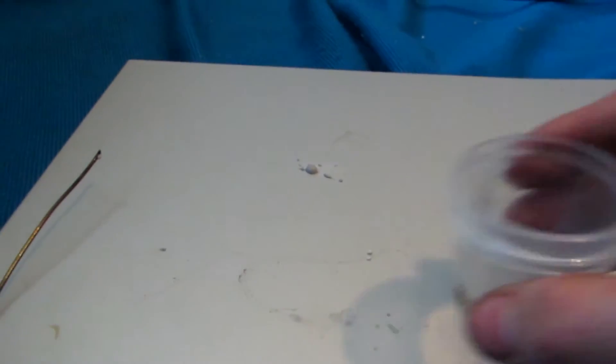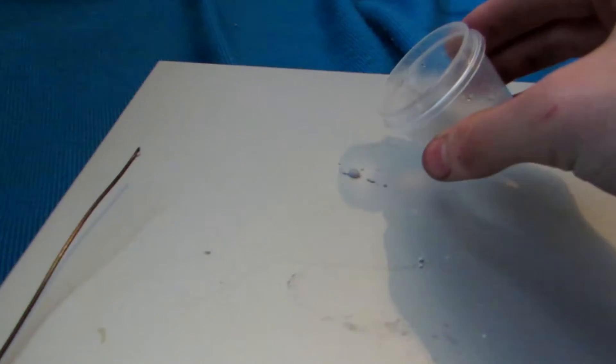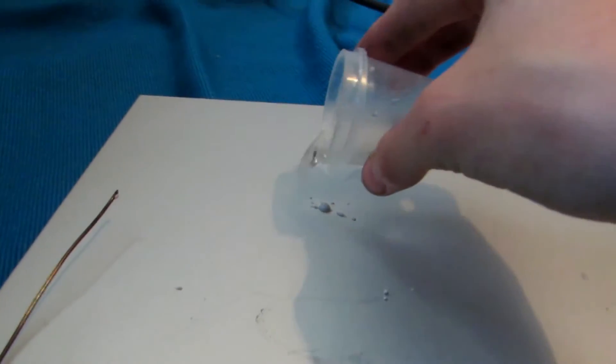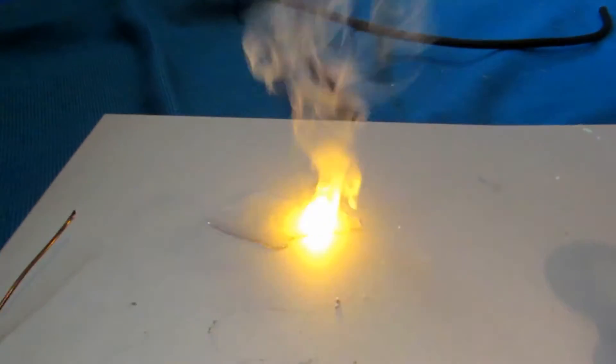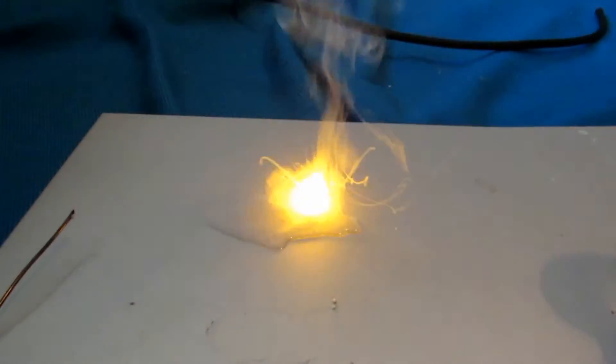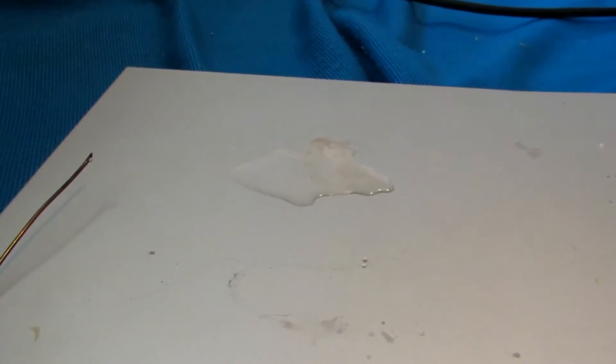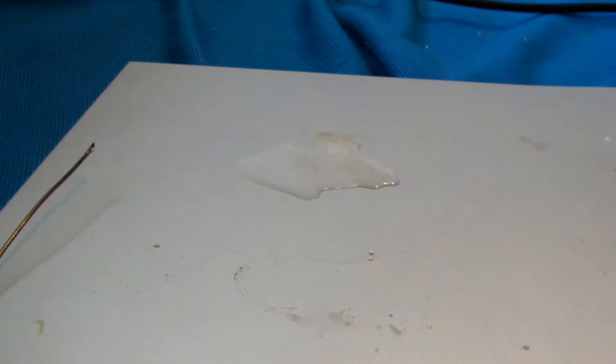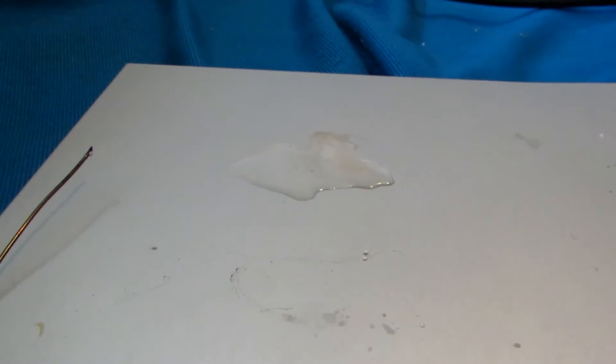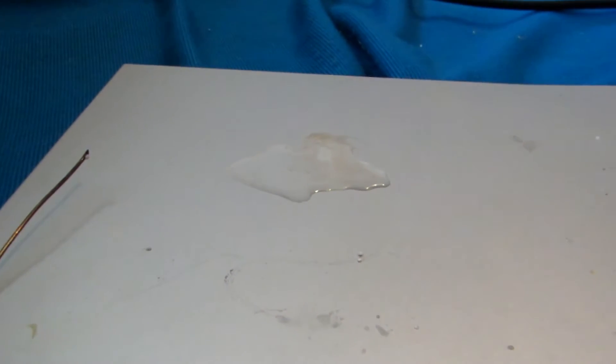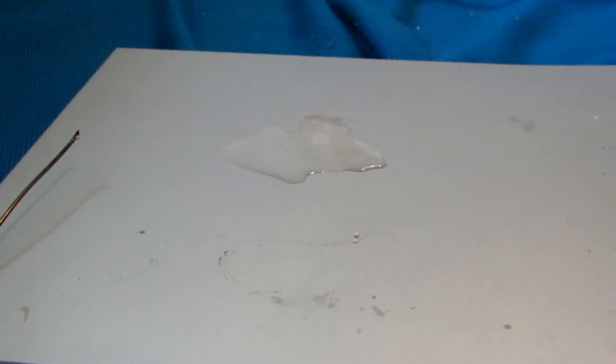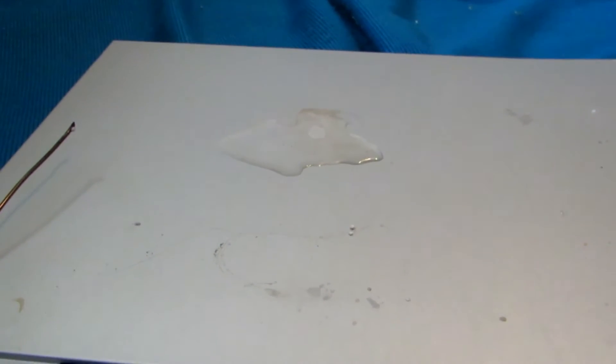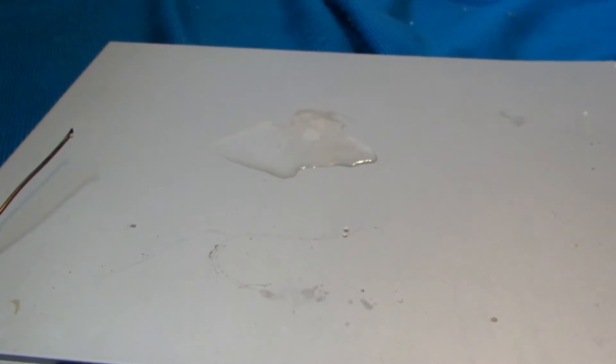Okay, so I squeezed out the rest of that, and I did spill a teeny drop. You can see it right there. And I couldn't help but wonder what would happen if, instead of putting it in water, put some water on it. So I do have safety goggles on this time. Oh wow. Wow. Yeah, so you can definitely see how reactive that is, and why it ate through my carpet, and tarp, and blanket. So anyhow, this stuff is seriously dangerous.